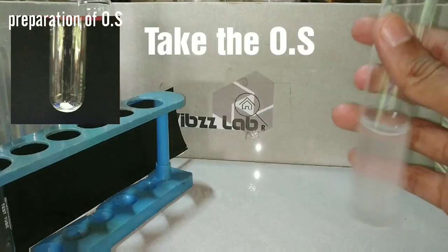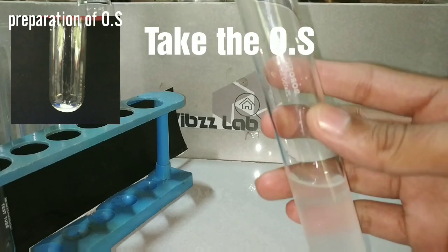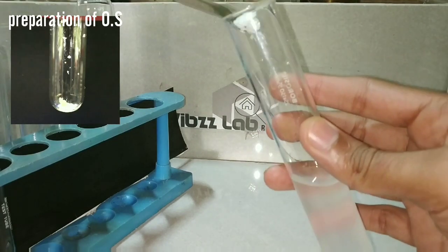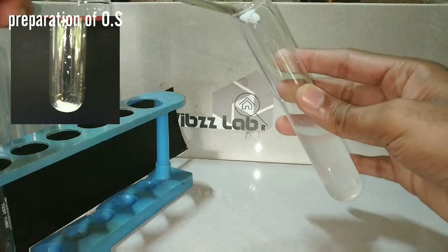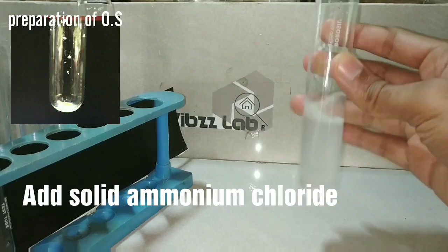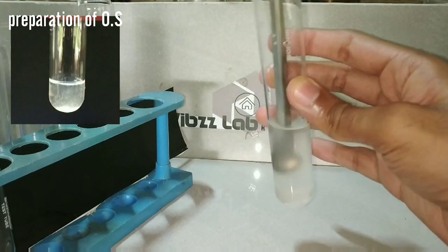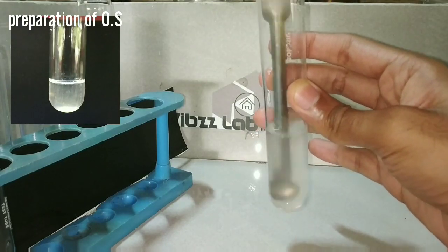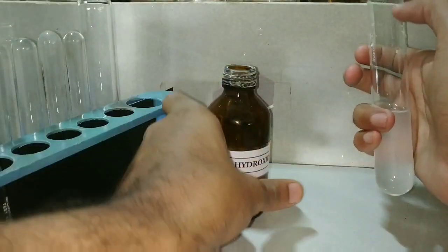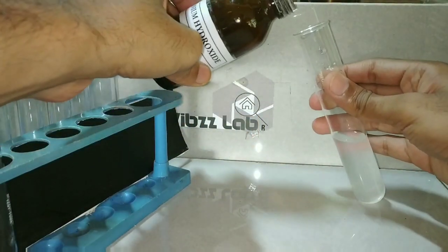Here we have taken the original solution. The original solution is prepared by dissolving the solid salt in distilled water, which you can see in the insert video on the top left. After preparing the original solution, I have added the solid Ammonium Chloride and mixed it well.